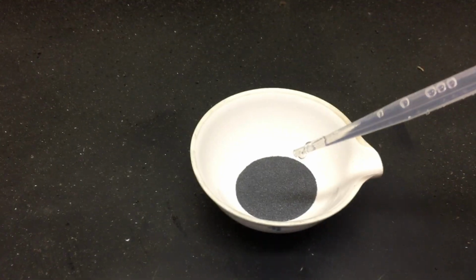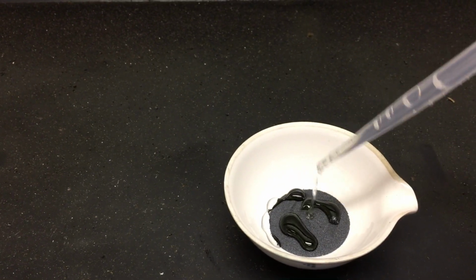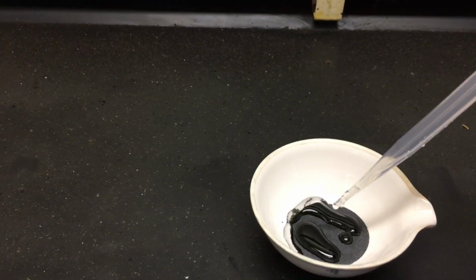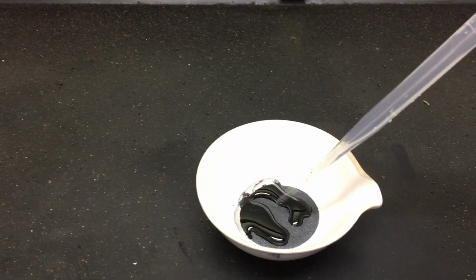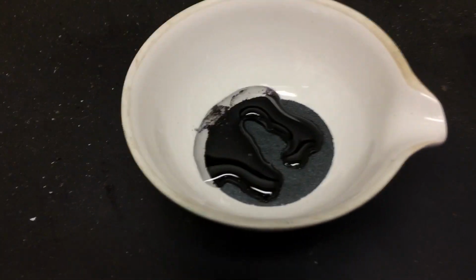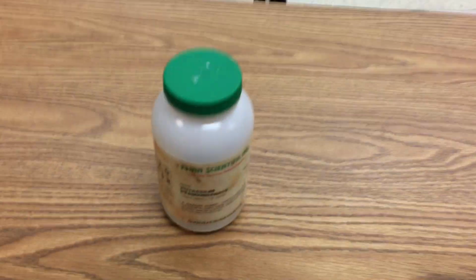You can see in here some of the glycerol, and I'm going to add it to the potassium permanganate. And that should be enough. Alright, so there we are. Now, like I said, that might take a second, so I'm going to just come back here and we will return to our 2 reactants.